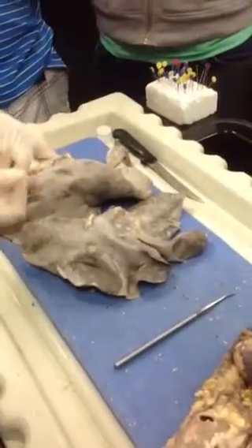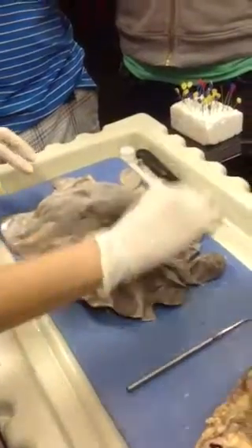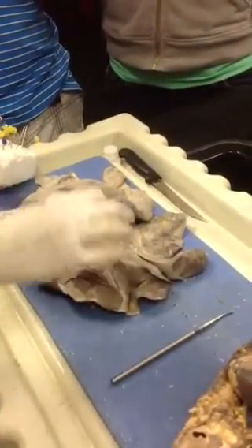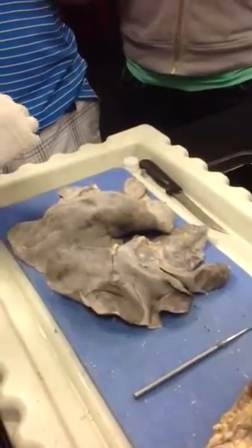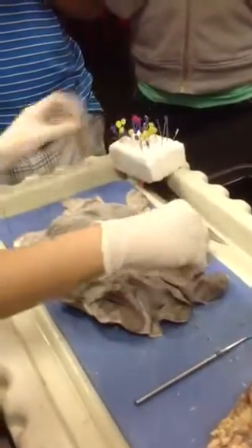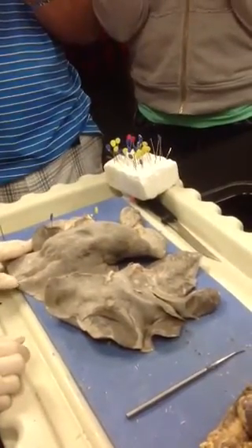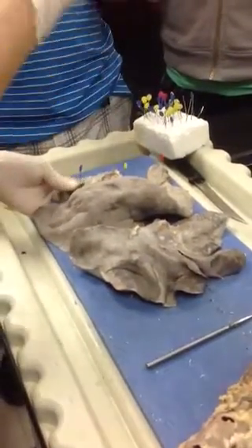Okay, so if we're going to label the lobes, you can see at the yellow, what is that? Superior. Left superior lobe. You always want to differentiate left versus right. At the blue, what is that? Left inferior lobe. How about here? Right superior. Right superior. Right middle. Right middle. And right inferior lobe.